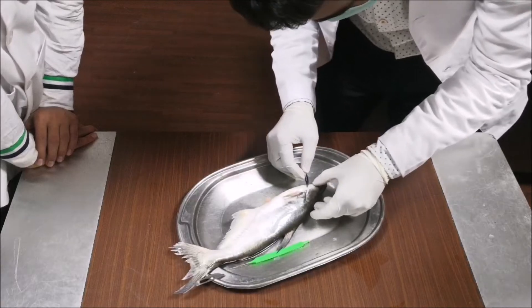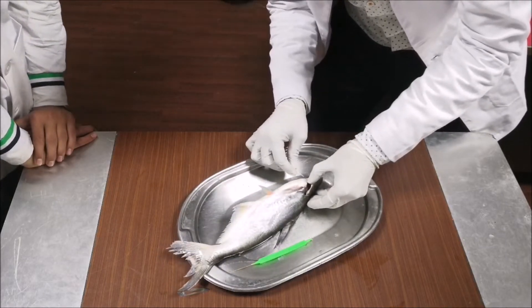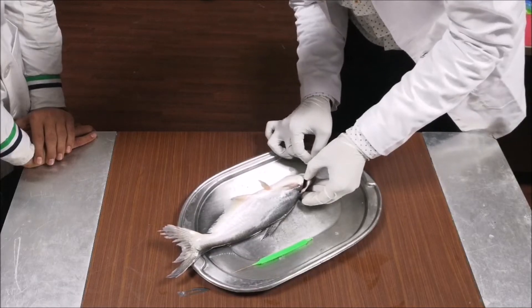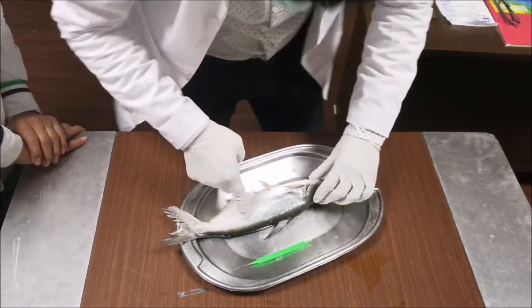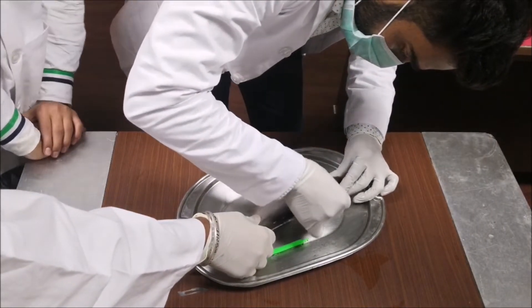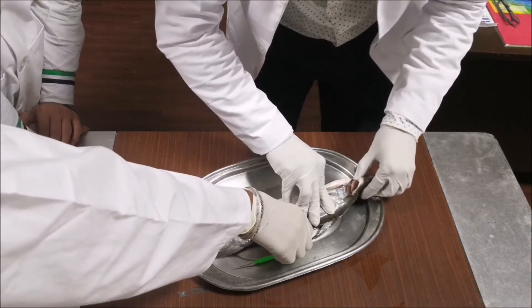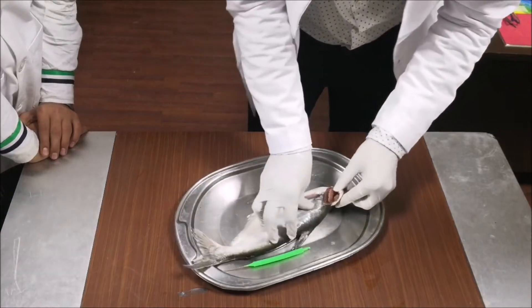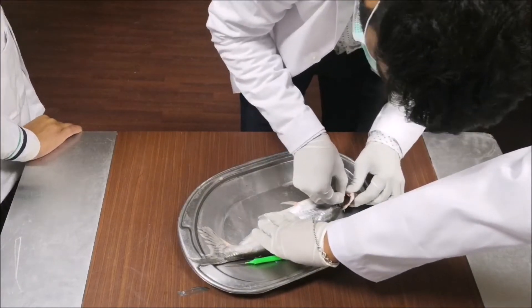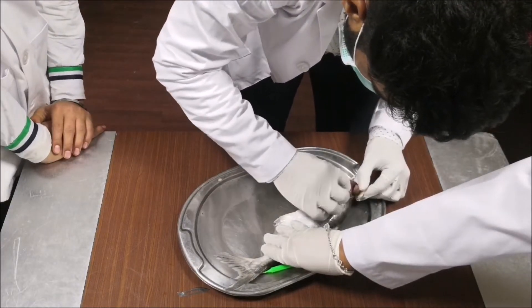When we remove this layer, we will dissect it properly so that we can see the whole layer. Can somebody help me by holding this with one hand? So these are basically the gills of the fish.